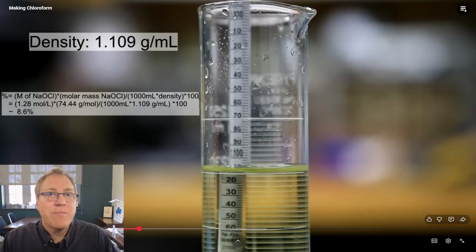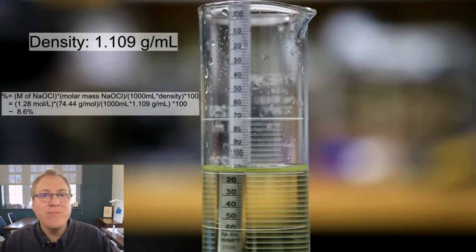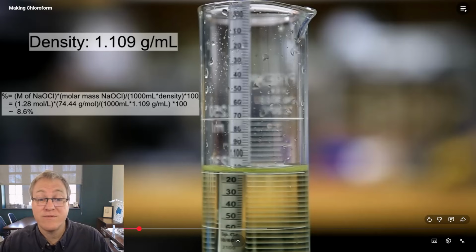Now, so he also did a backup. He's like, I got this titration. Maybe he was questioning whether it was accurate or not. So he used a different method, hydrometer to measure the density of this solution. From the density, he determined another concentration as 8.6%. So, he's just got a backup method to see, does the titration make sense? Do I trust this titration? Apparently, this result helped him trust the titration so he could move ahead and do the reaction with more confidence.